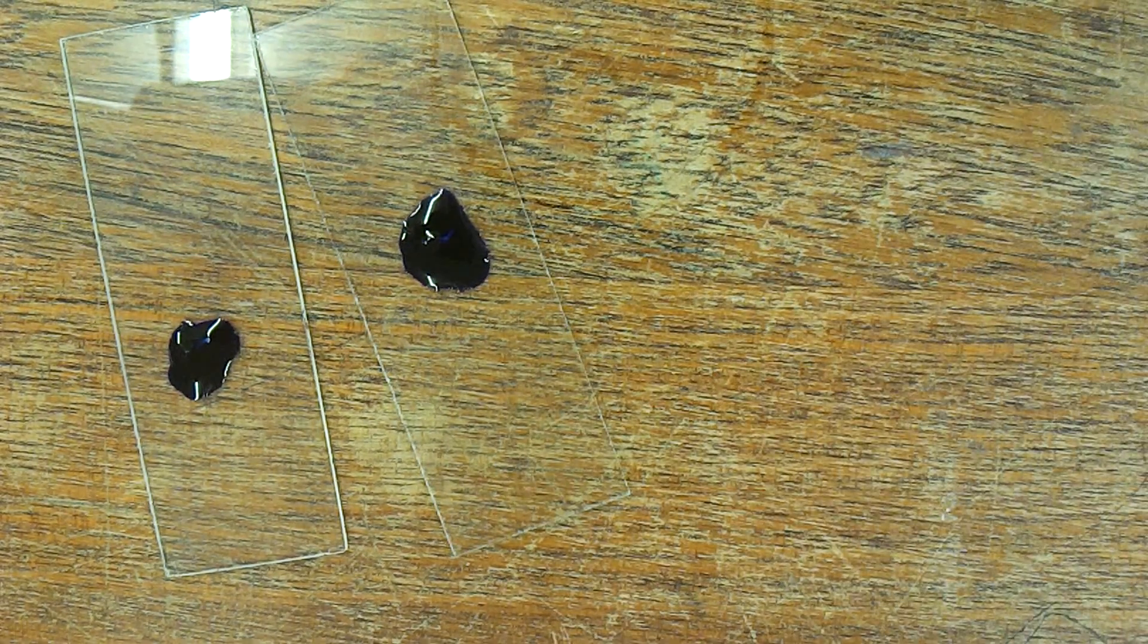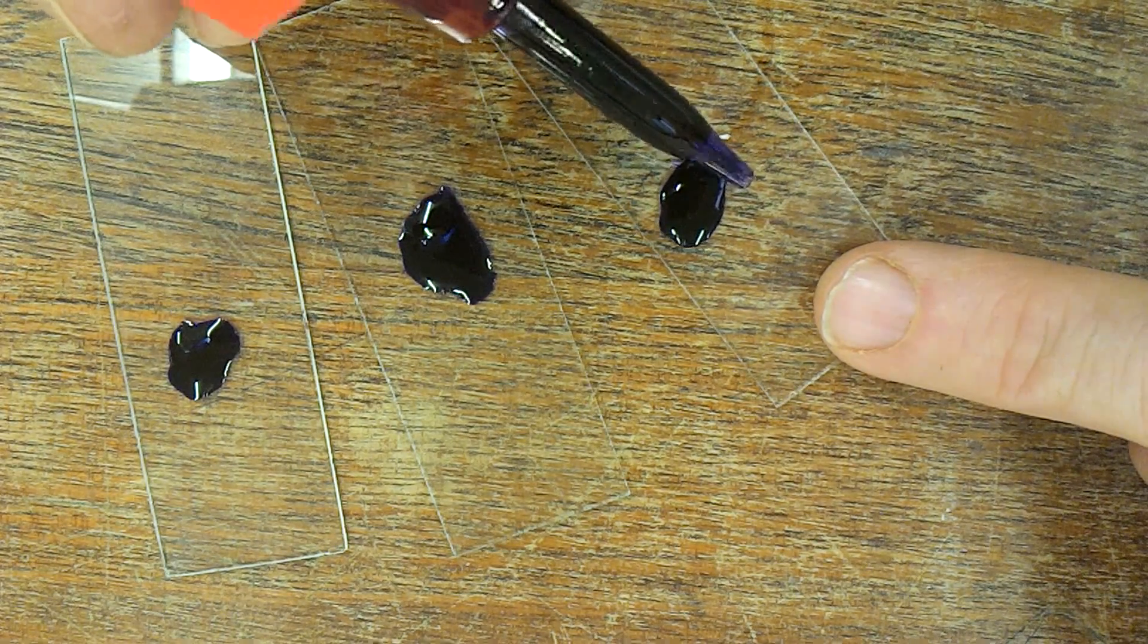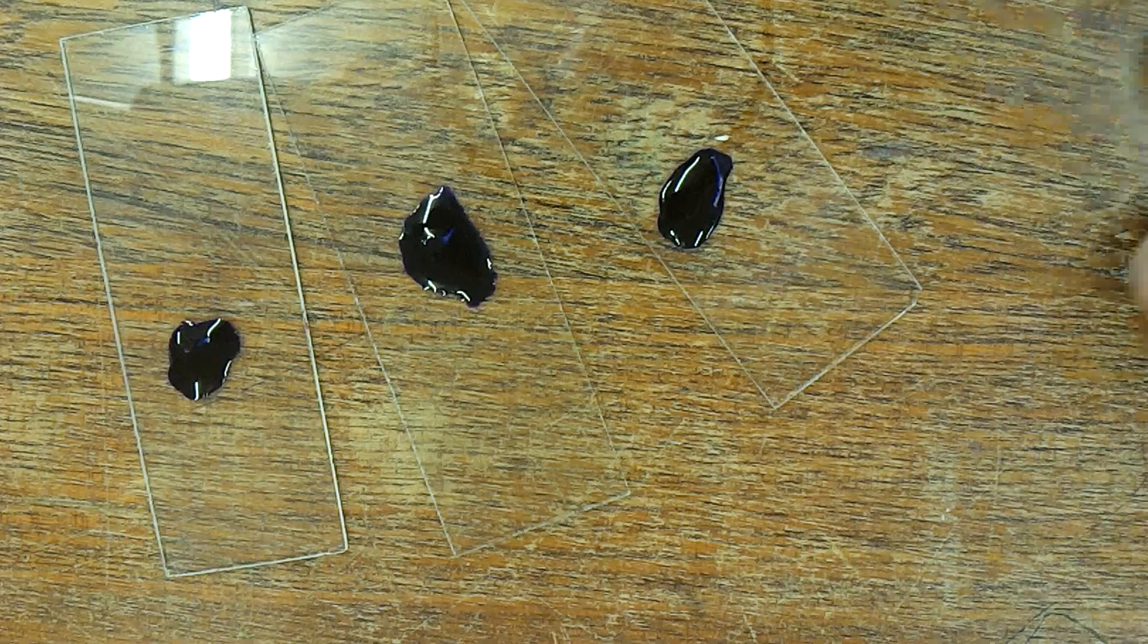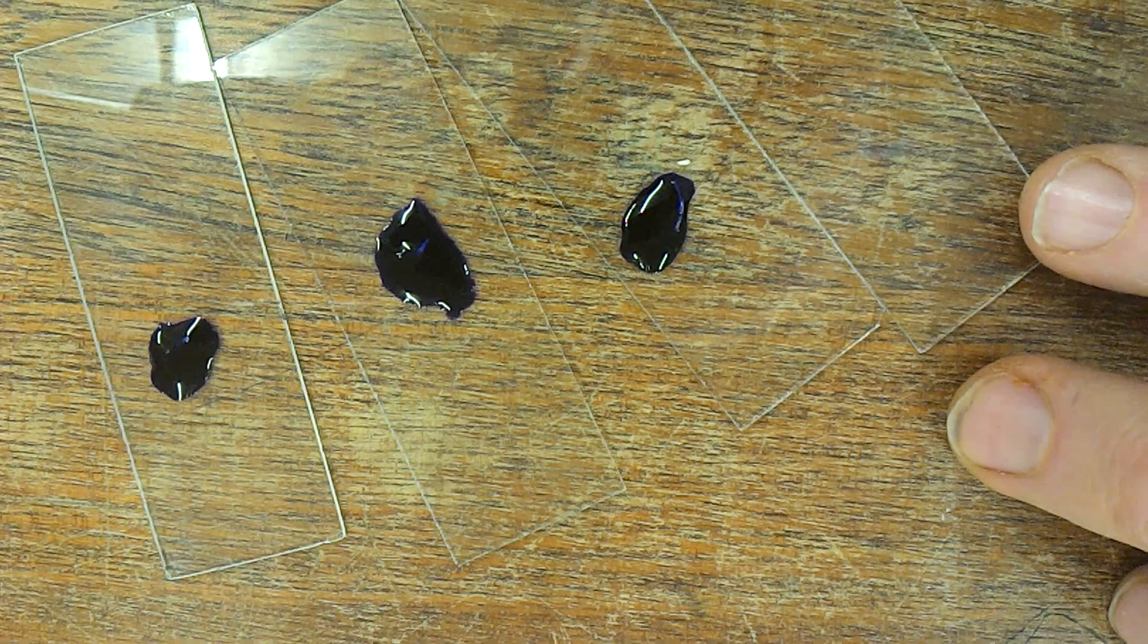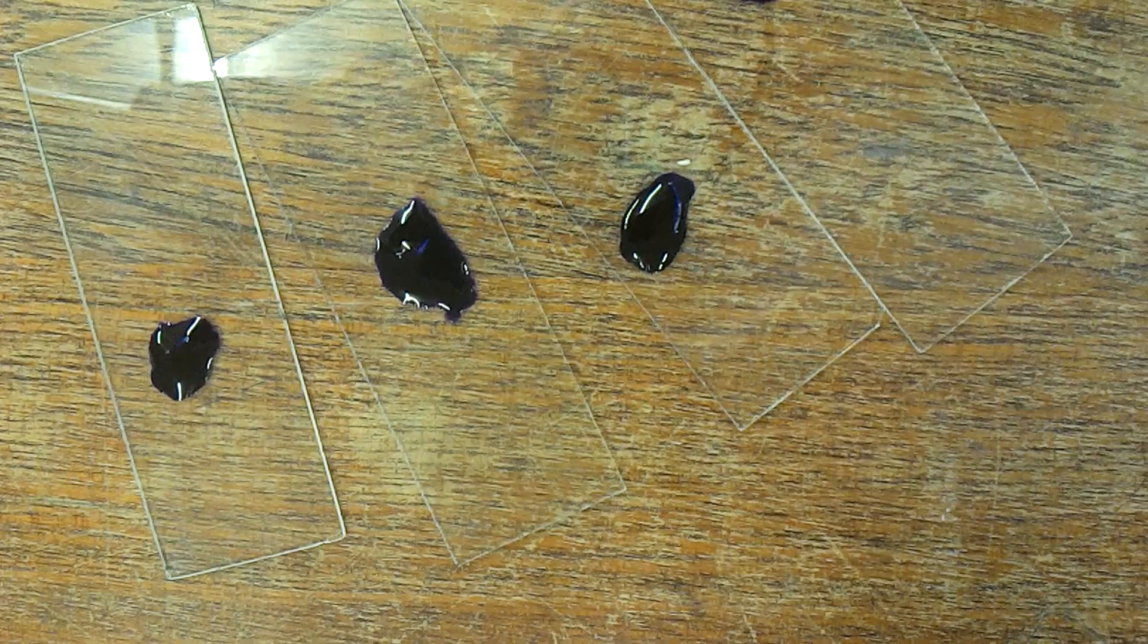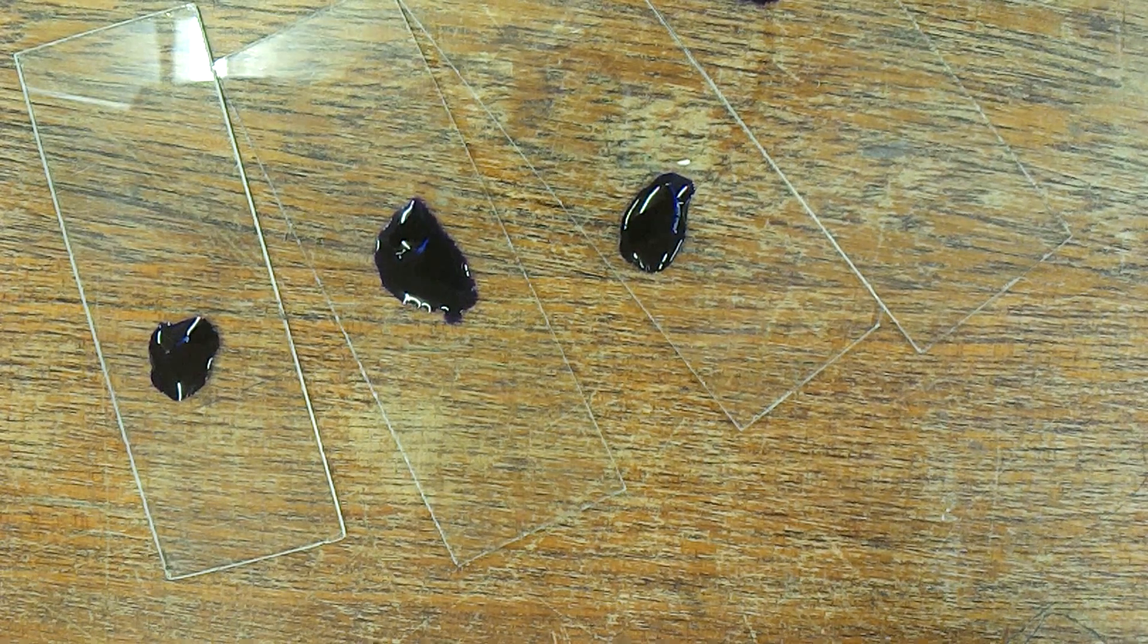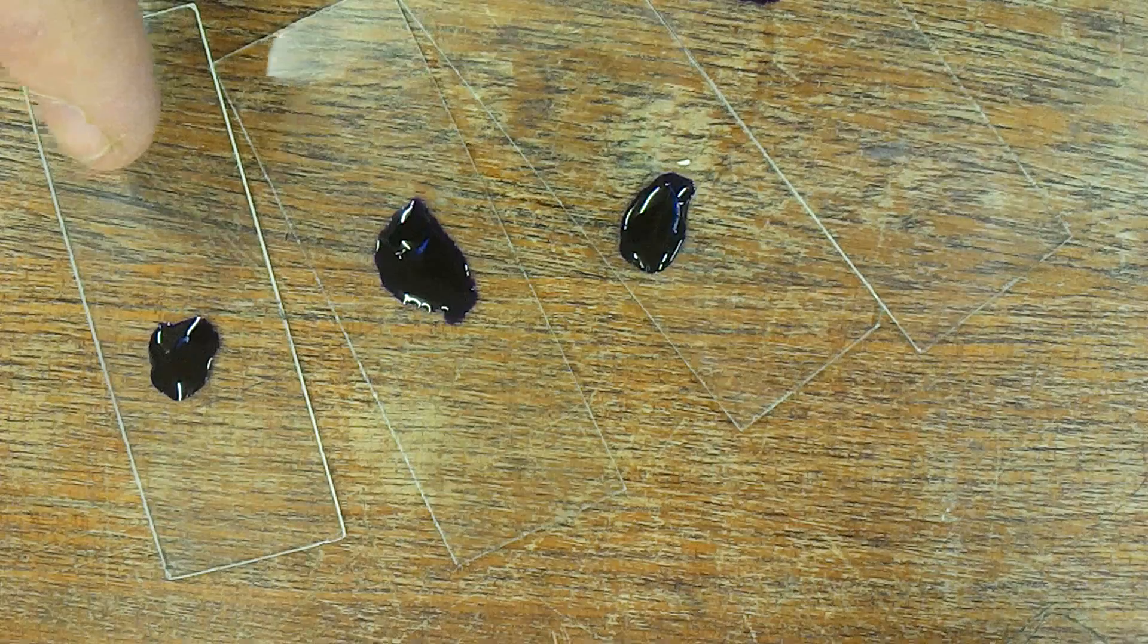After another two minutes, stain the third one. After another two minutes, you can stain your fourth one, and you will have a range of staining times. Leave the stain on for two minutes for the first one, and then you need to cover slip.